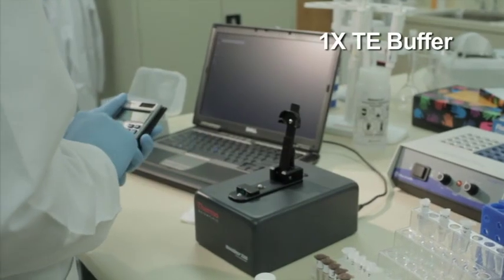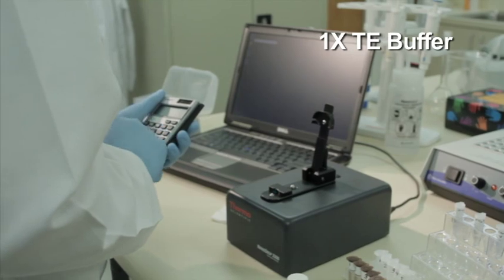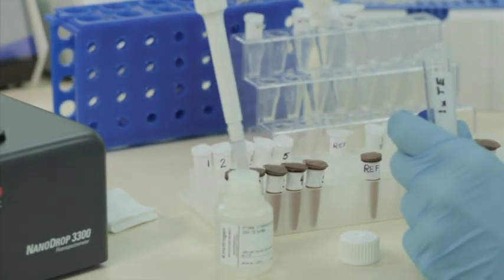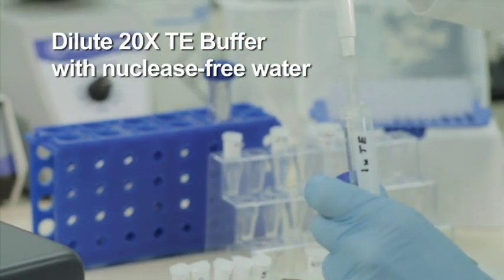Prepare enough 1X TE buffer for all standards and samples to be measured, as well as for the pico-green working solution that will be needed. Prepare 1X TE buffer by diluting the provided 20X TE buffer with nuclease-free water per the manufacturer's protocol.